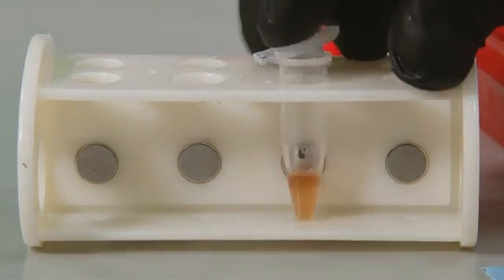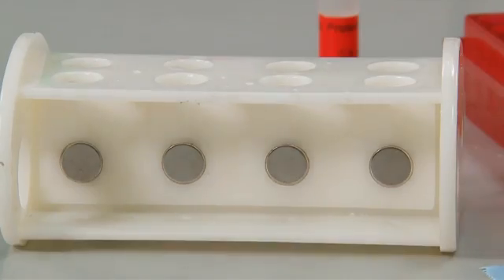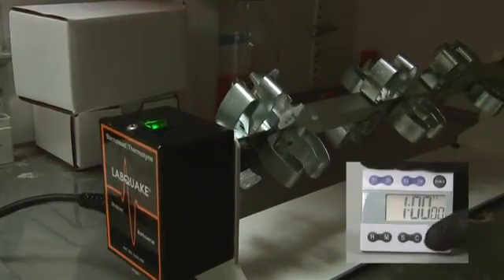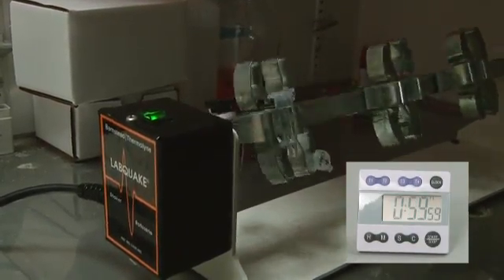Add 25 microliters of washed beads to each sample and incubate tubes with rotation for 1 hour at 4 degrees Celsius.